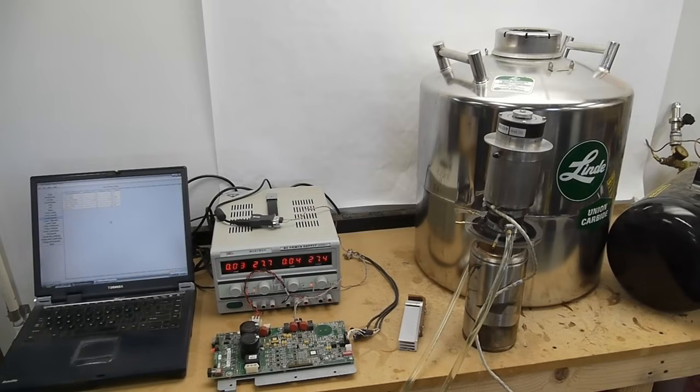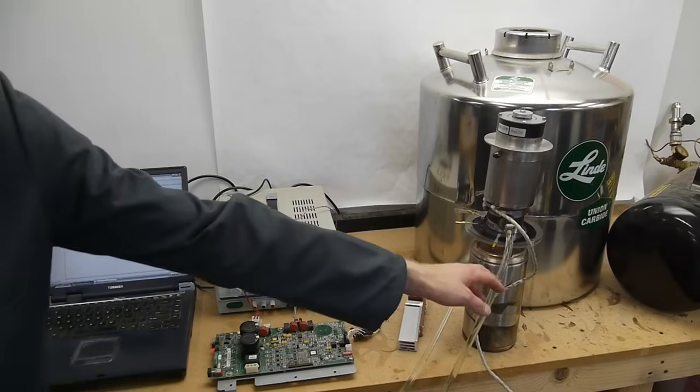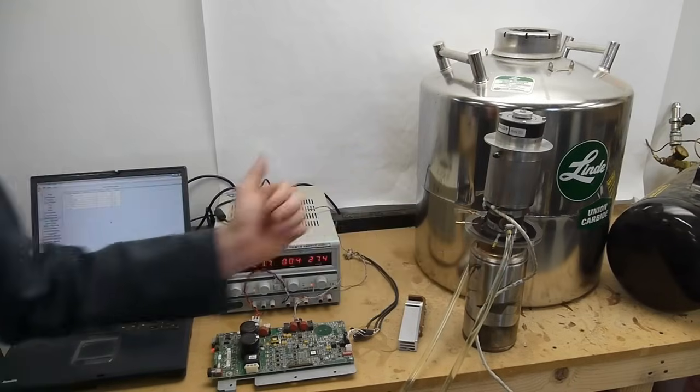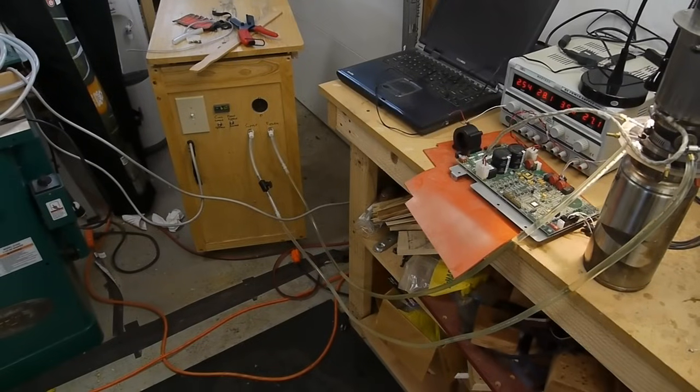So the whole thing was marketed as this device that you could install in your cell phone tower and it included all the self-monitoring. It was completely self-contained didn't require water cooling or anything. In this case I've replaced the fins and the fan that used to be on this for air cooling with the tubes that are going to my water chiller so now it's a water cooled device.